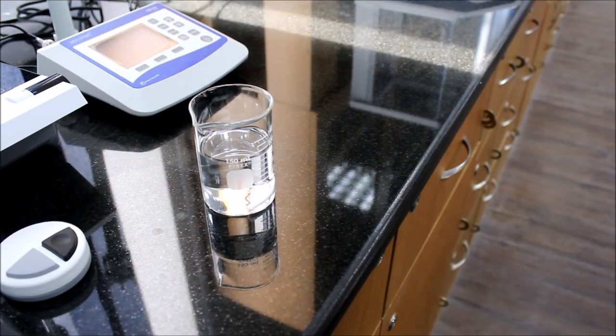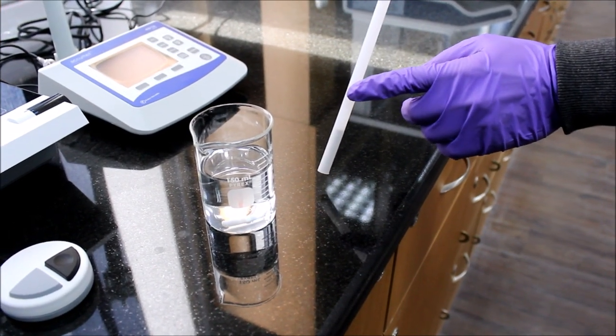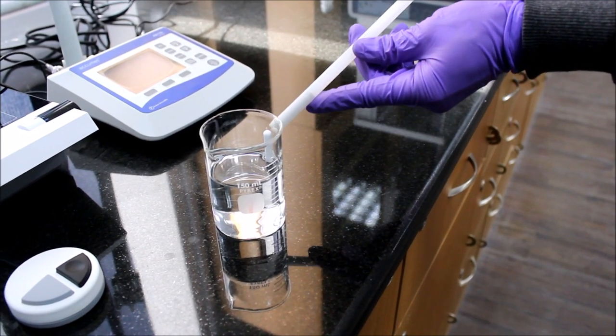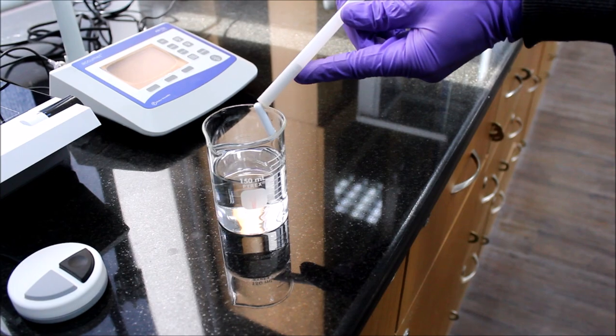To take the stir bar out of the beaker, use the special magnetic rod. The stir bar should also be washed with DI water and dried with paper towel.